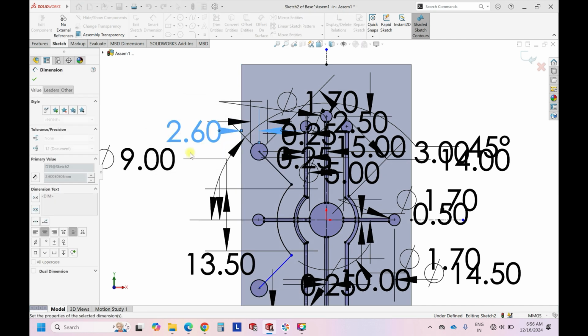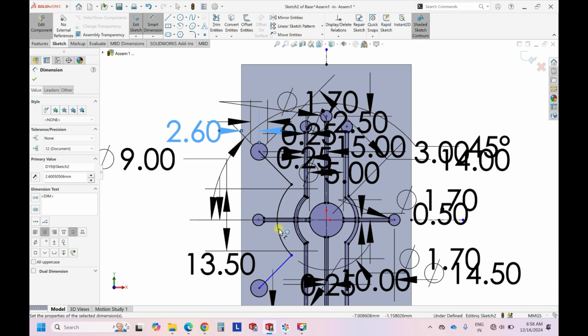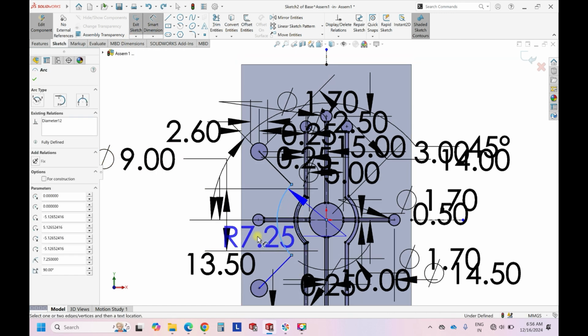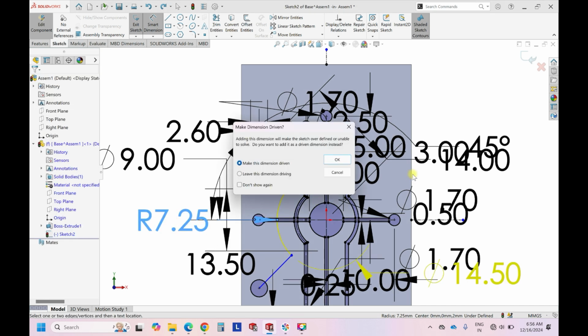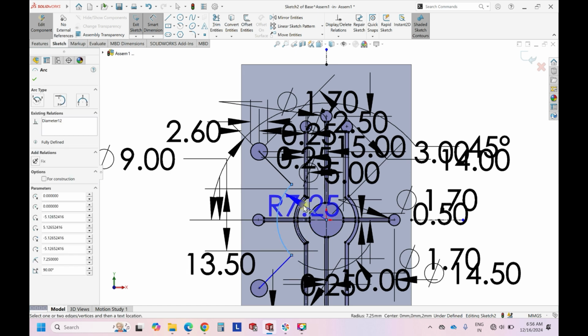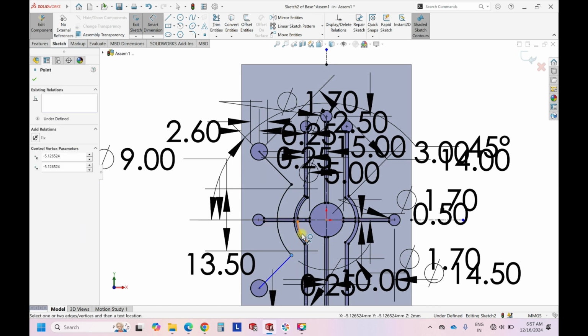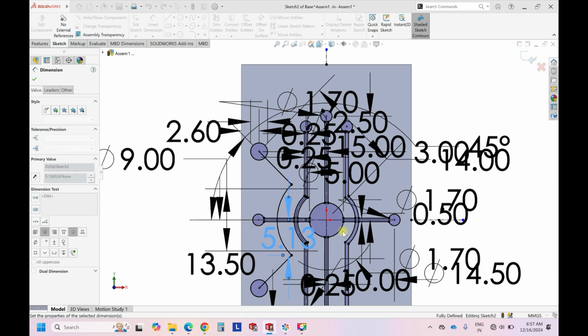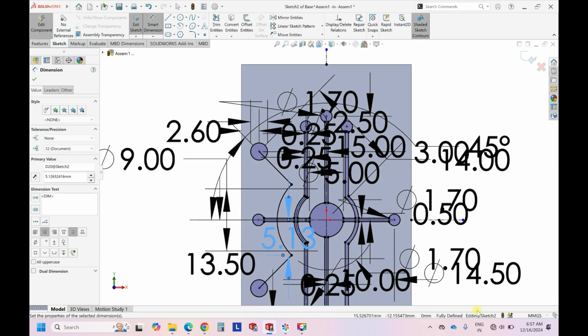So let it be 2.6. And then if you see, this one line is again blue in color, so it is moving in this direction. Okay, so Control Z, and then so there's already having, so we can fix this point and this line. Right, so now again it is fully defined.